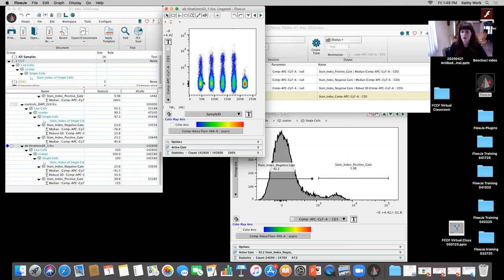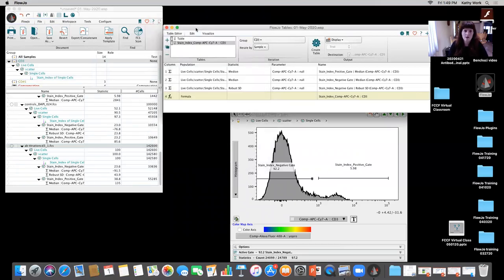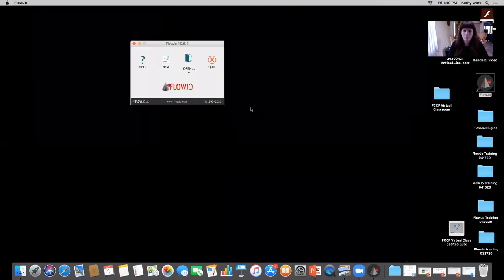This is just an example. We're not really seeing anything too crazy, but we're not getting to the point where we're seeing a decrease of that separation index as we increase the concentration. And what I would suggest to do to start off with is to start off at 10 micrograms per mil and do about 7 to 8 serial twofold dilutions down. Is that good, Rui? Is there any other questions on that section? No, that's good. Thank you.